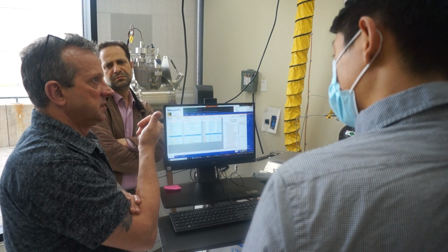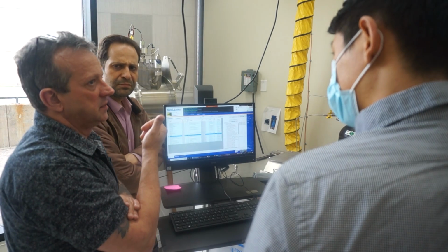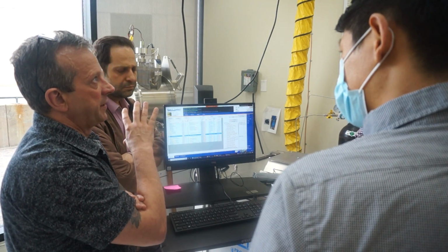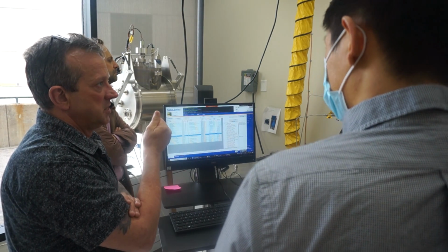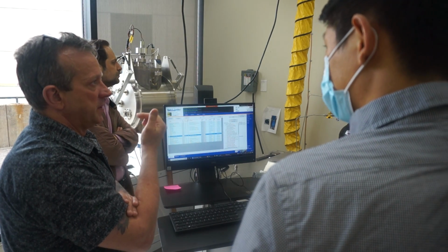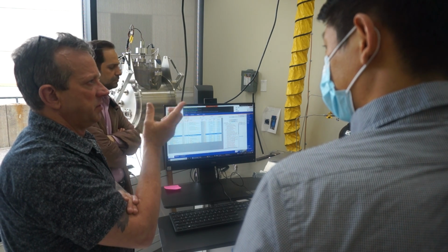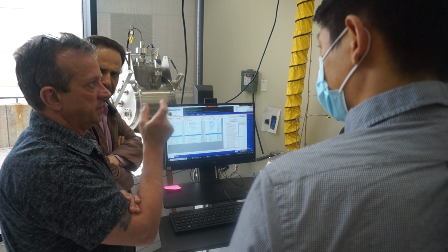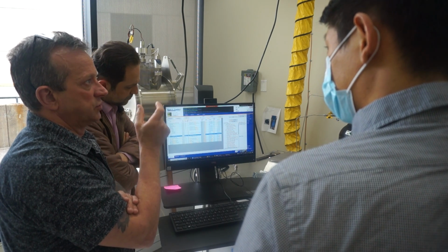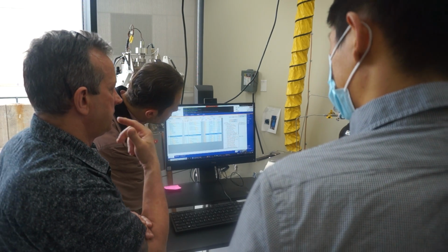Especially with indium, it's best to protect everything as much as possible with foil and tape, because it'll creep into little small places. If you have a crystal shutter that has an actuator, it'll eventually work its way into the mechanical mechanism, and then it'll start dragging. Wow, indium is weird stuff.